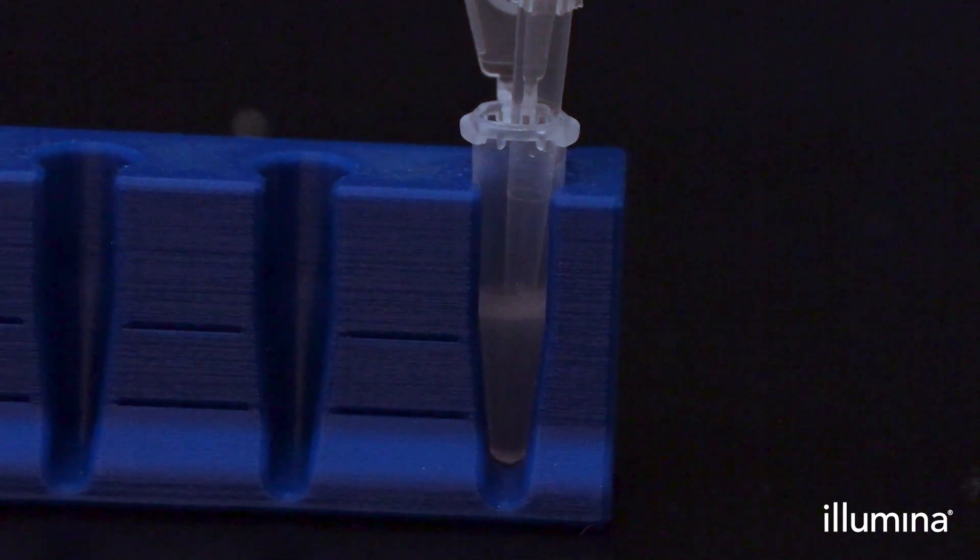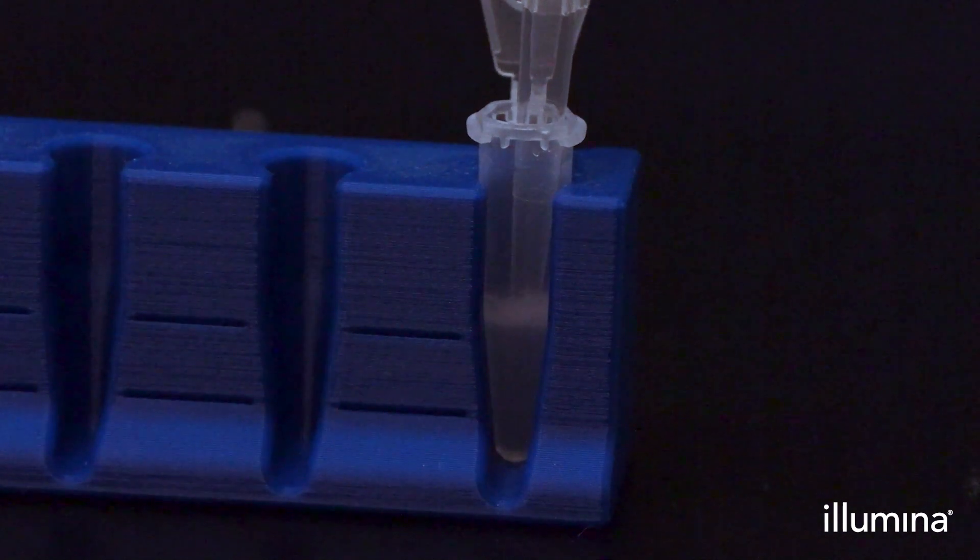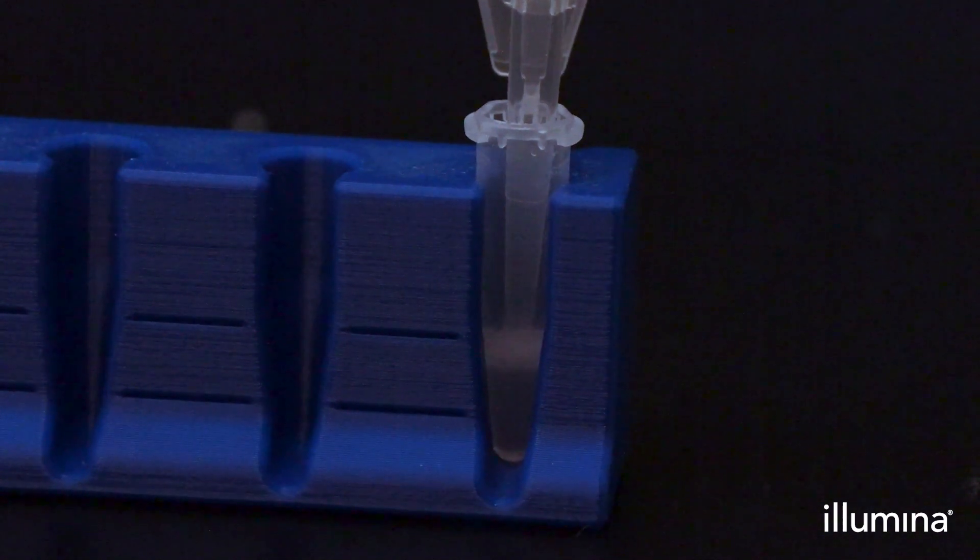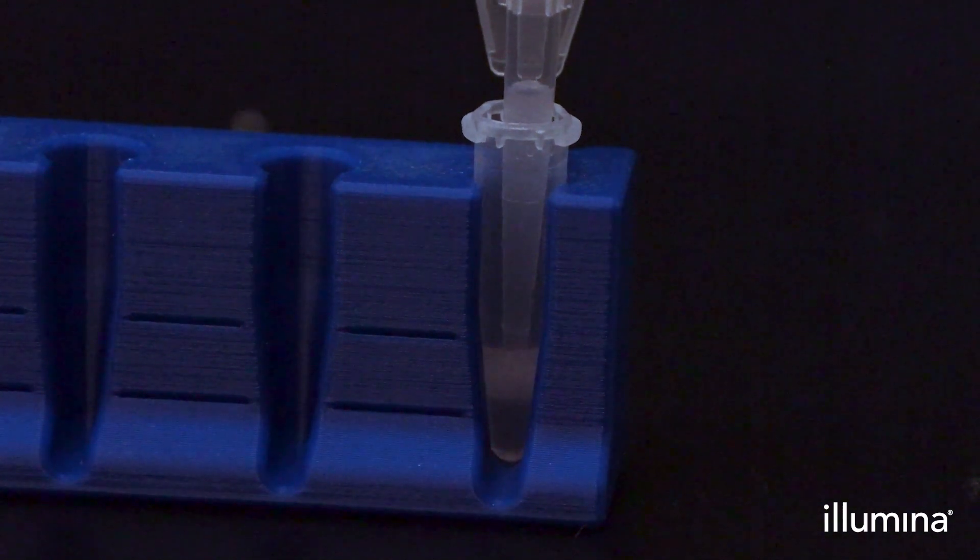The user will repeat this step a second time to remove another 115 microliters from the bottom phase using the same technique to avoid sample loss.